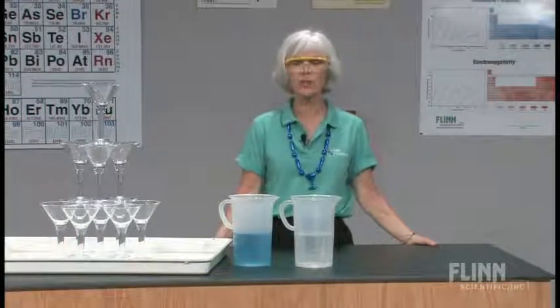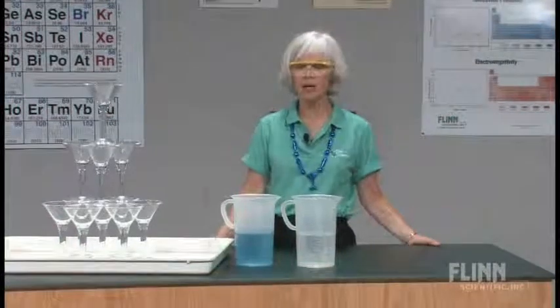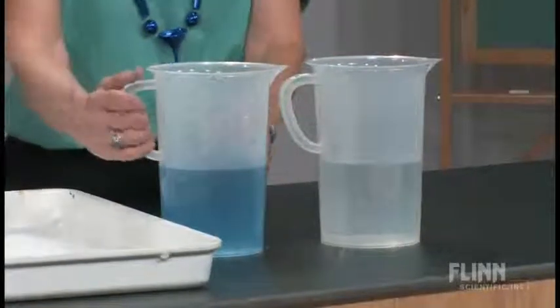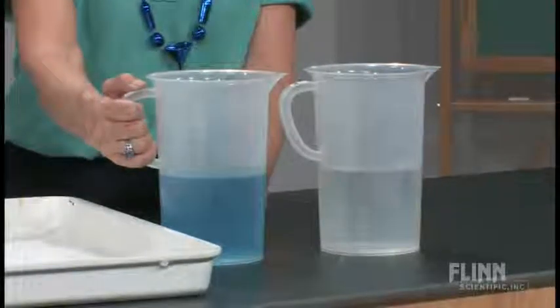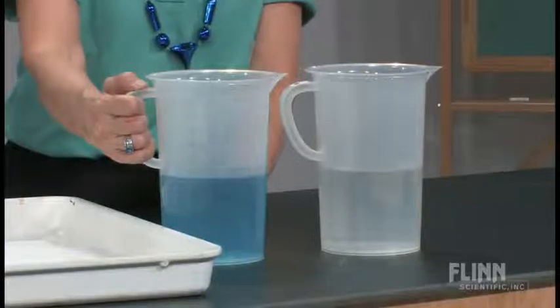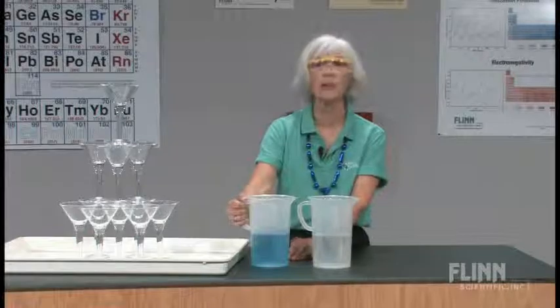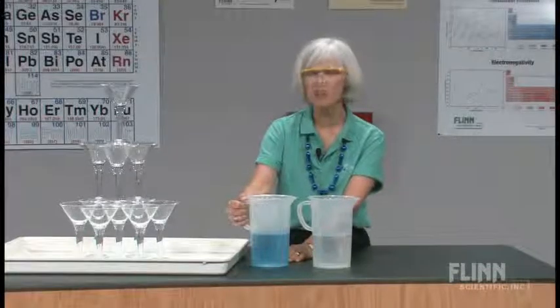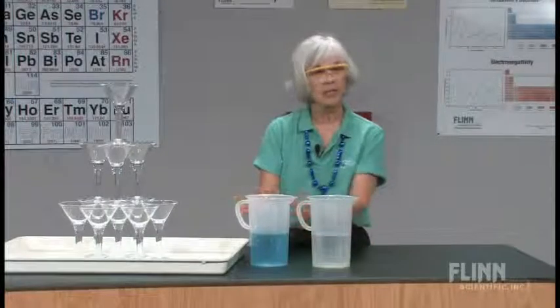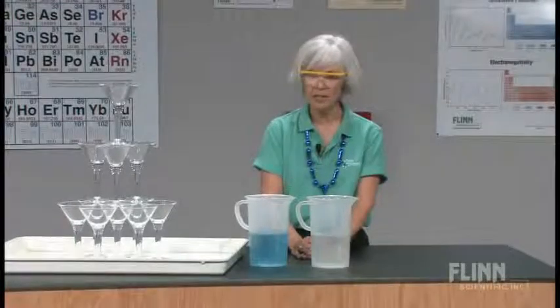I first have my students focus on the two solutions I'm going to use in the demonstration — we'll call them Solution A and B, though I will mention some of the components. Solution A, students will notice, is a light blue color. My students are pretty astute at this point; we've used so many solutions of compounds of copper that they will guess there's copper ion in there, and there is copper two-plus ion. But there's also a chemical in there known as luminol, and some other chemicals which will be in the written documentation if you want to know the detailed chemistry.